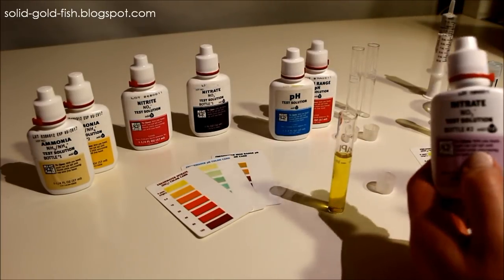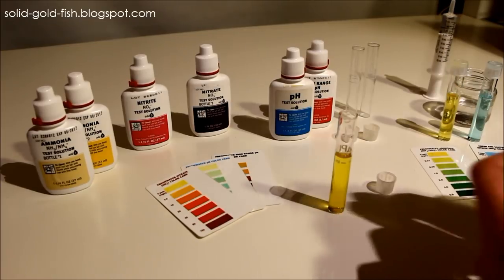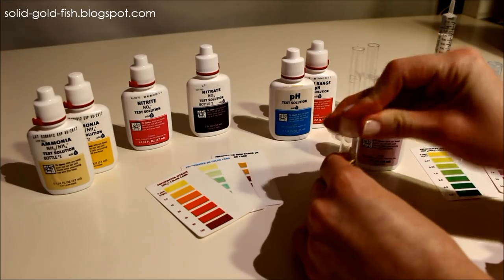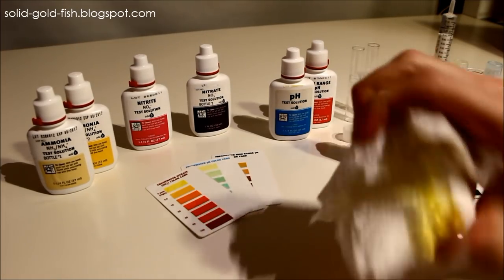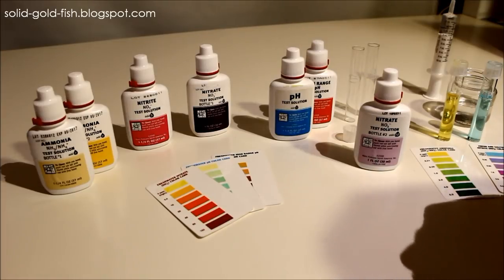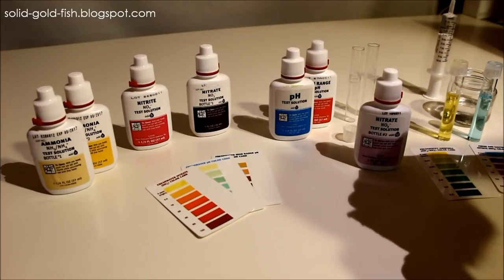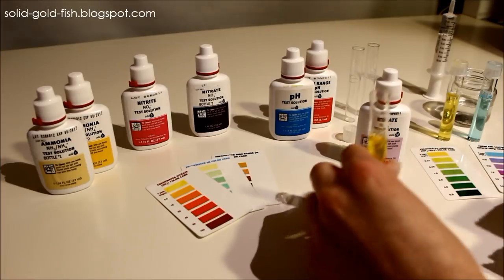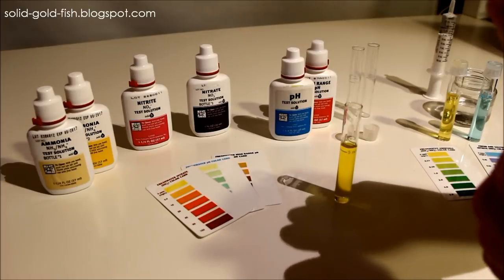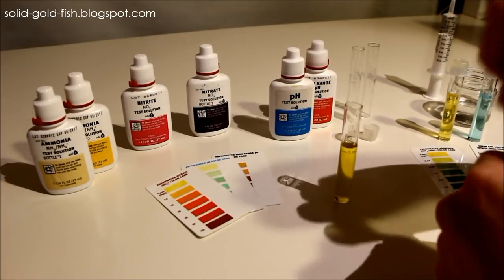But before you add from the second bottle, you have to shake it for 30 seconds. You should also cap this and just invert it a few times, shake it up a little to make sure that the drops from the first bottle are mixed evenly. You don't need to do that with the ammonia test, but you do need to do it with the nitrate test for some reason.